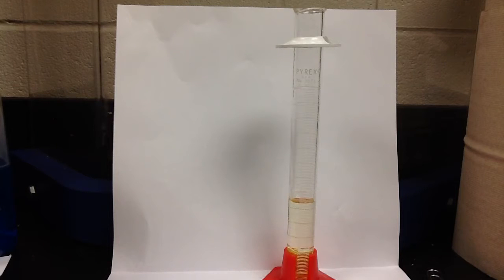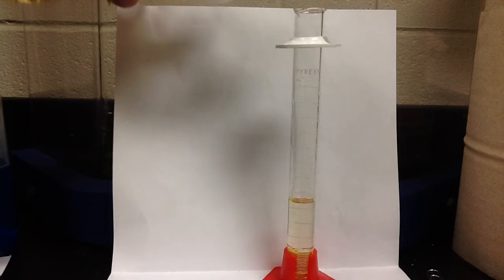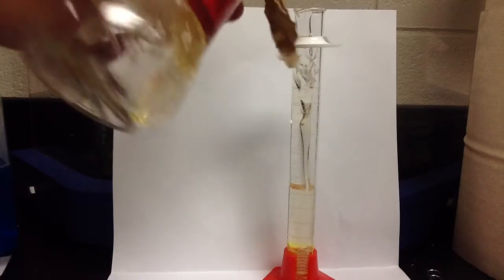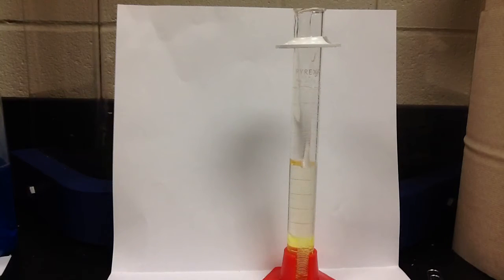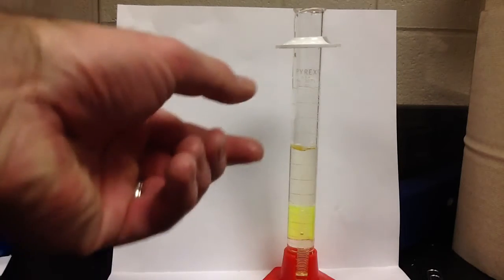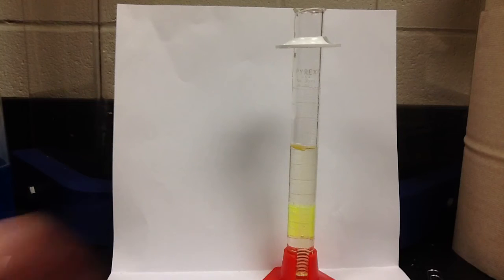And now I'm going to try some Karo syrup. Further exploring, does the order in which I pour these impact how they form layers? There's some thick Karo syrup. Alright. So, the Karo syrup is also kind of a pale yellow color. And you can kind of see, hopefully in the picture there, the Karo syrup is actually forming a layer below the antifreeze. And even though it's a little bit tricky to see with the base of the graduated cylinder, you actually see the layer of antifreeze kind of moving up because the Karo syrup actually formed a layer below it.